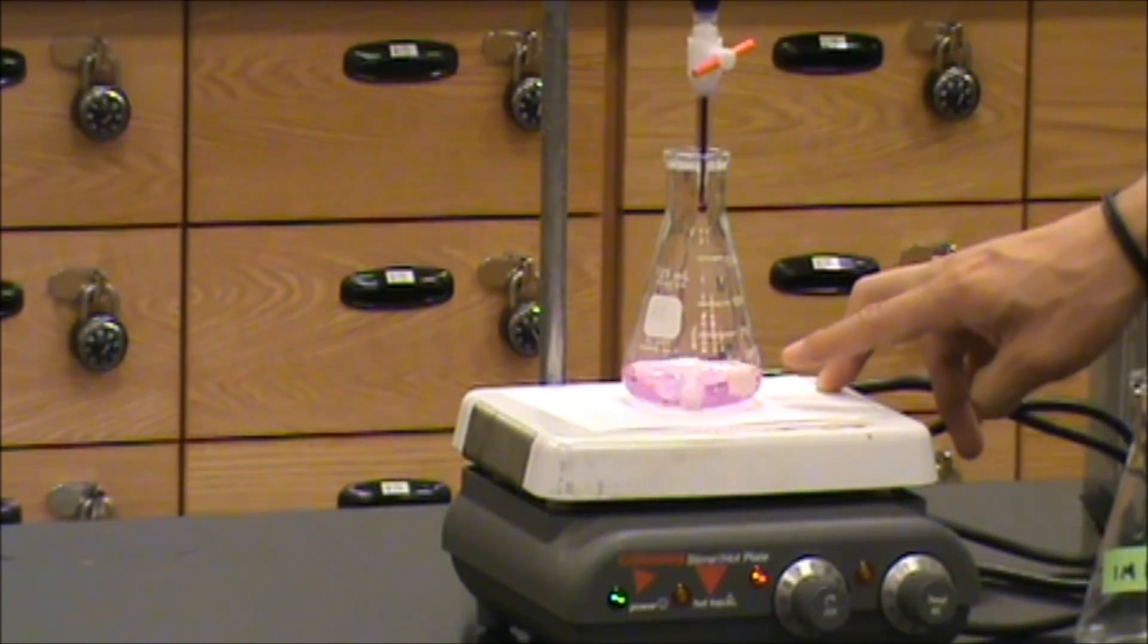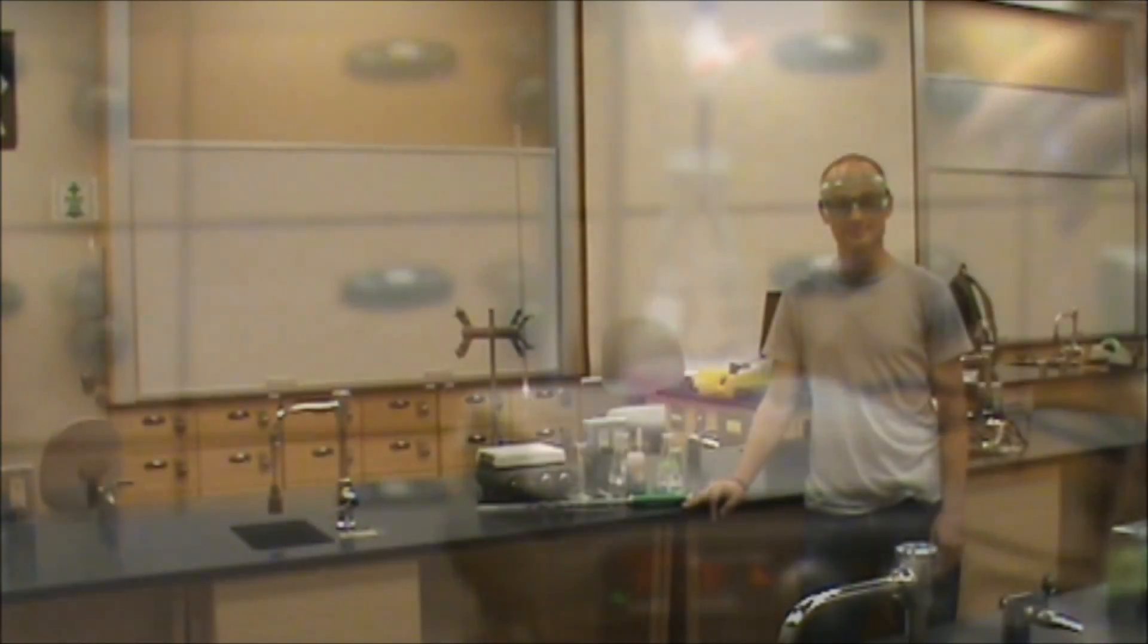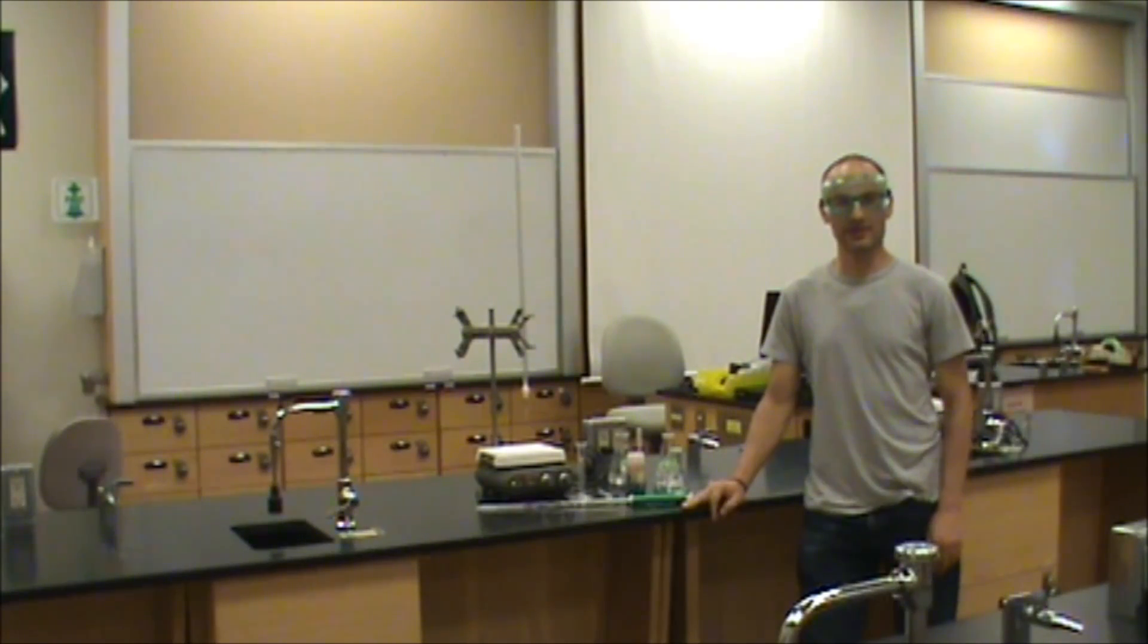The analyte should be disposed of in a waste container as usual rather than poured down the drain. I hope you found this tutorial helpful. As always, if questions arise, please ask your lab instructor. This is Dr. Nick, signing off.